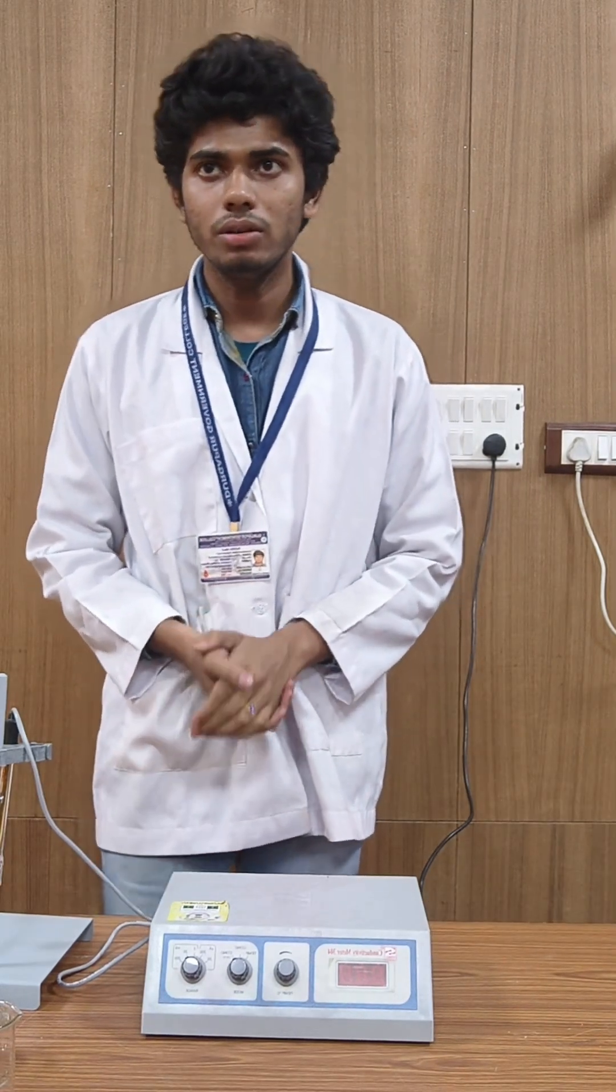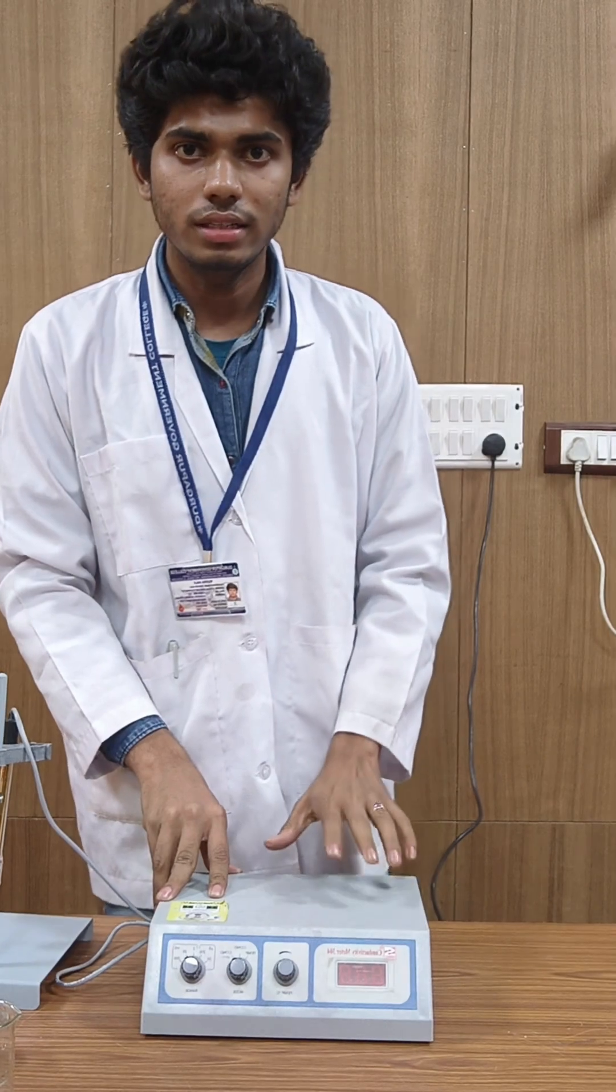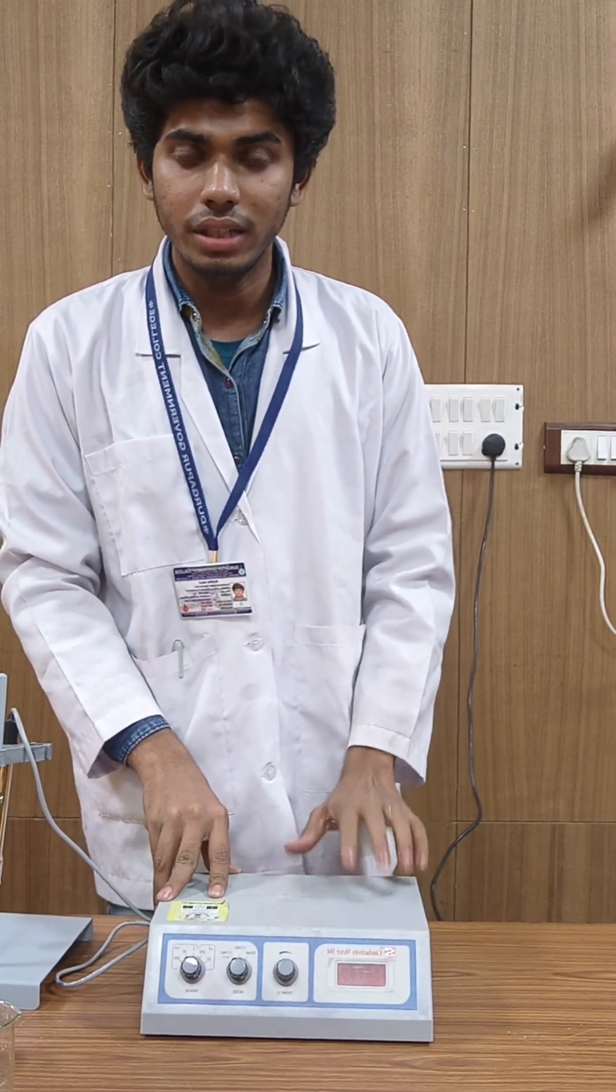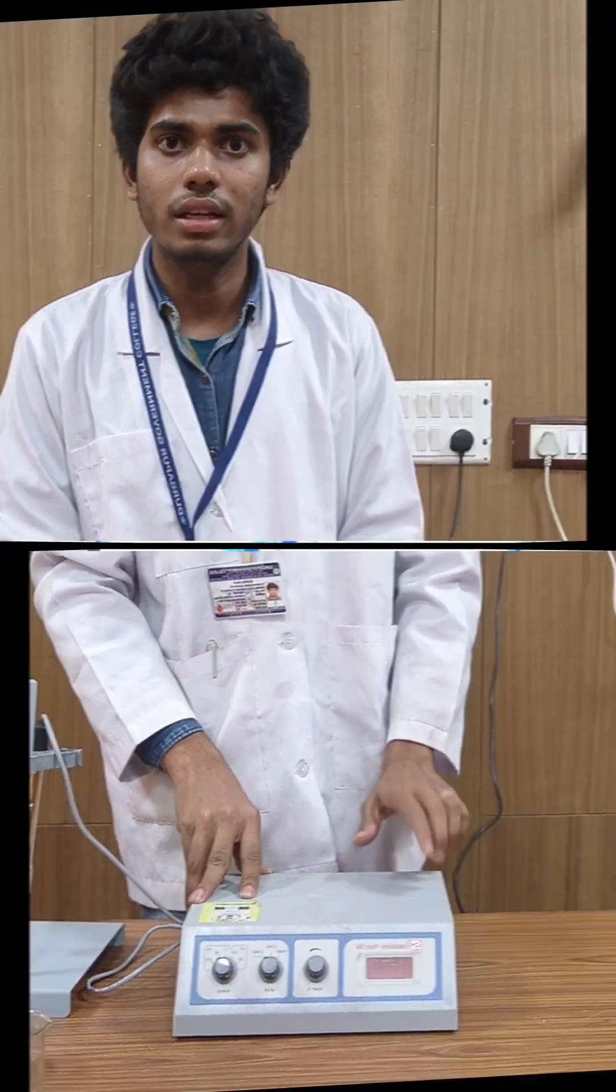Today I will demonstrate how to use the electrical conductivity meter. This instrument measures the electrical conductivity of a solution and determines the concentration of ions in a liquid.